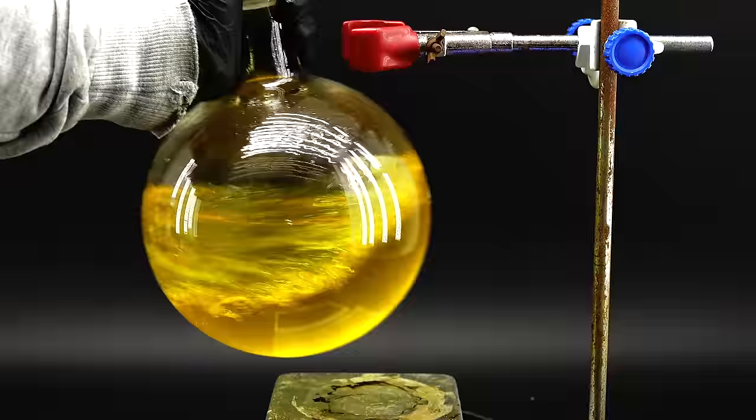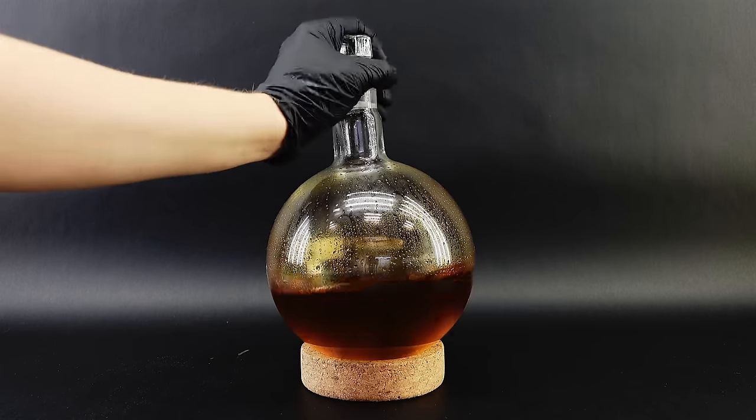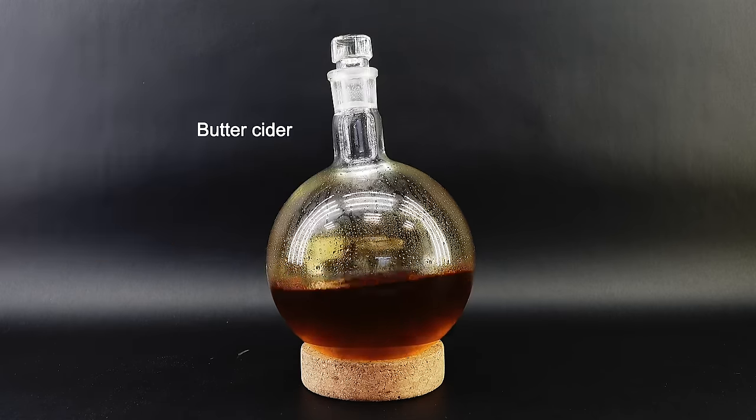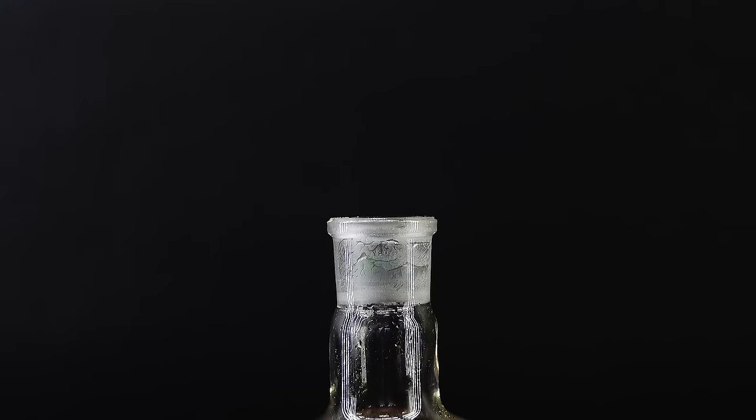That's because there is still quite a bit of unreacted starting materials present and to drive the reaction to completion it has to sit undisturbed for quite some time. When the week was up this whole thing really looked like it fermented, taking on this more refined dark orange color. It also already smelled like some nice buttery popcorn, confirming that I succeeded in making at least some diacetyl.